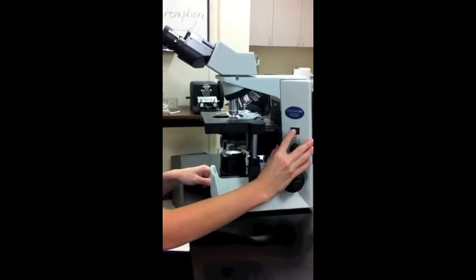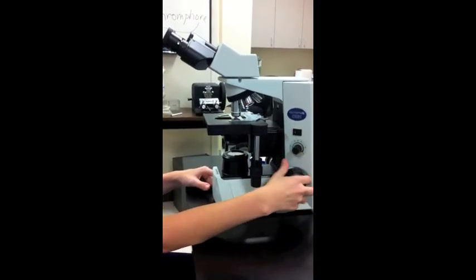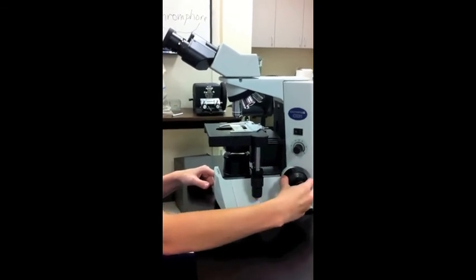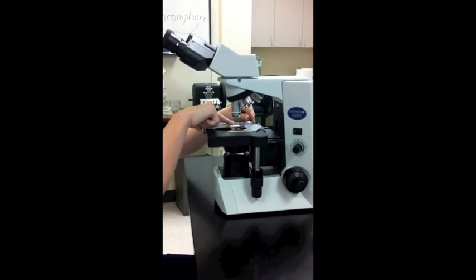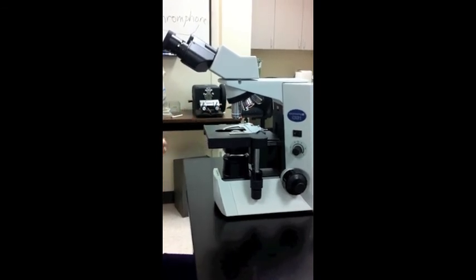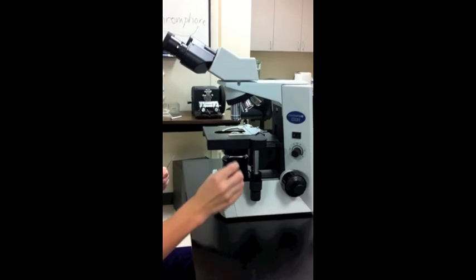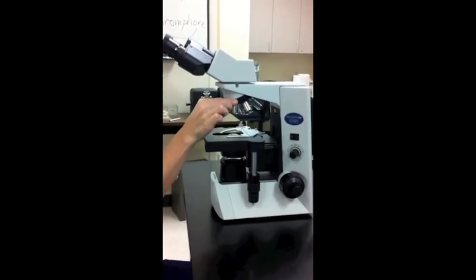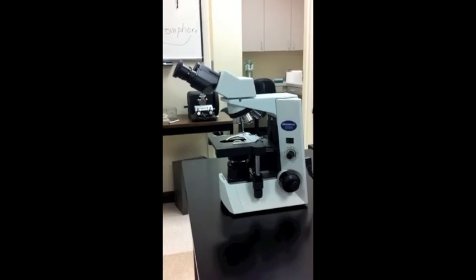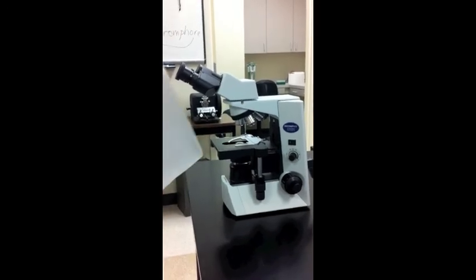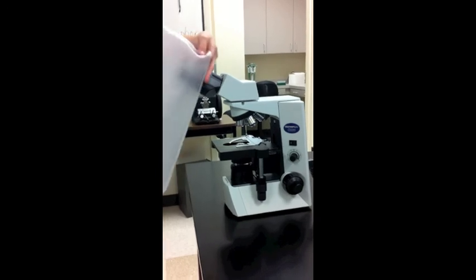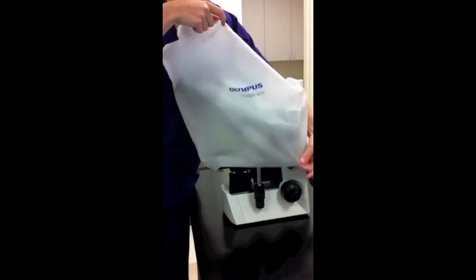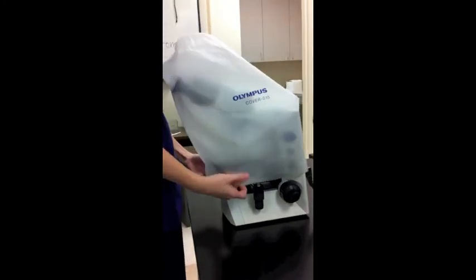Turn your light source off, lower the stage, take the slide off the stage, and rotate once again your 4X objective back into position. The microscope is now cleaned and ready for storage. At this point you can put the dust cover on and it's ready to be put away.